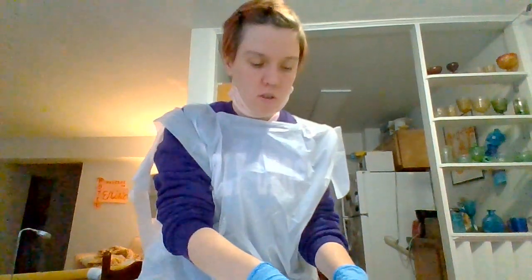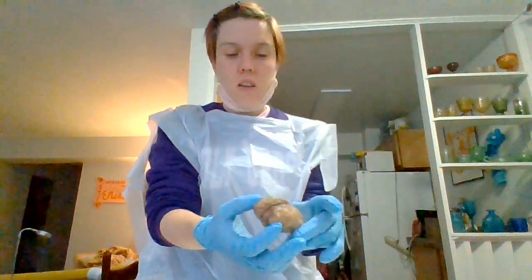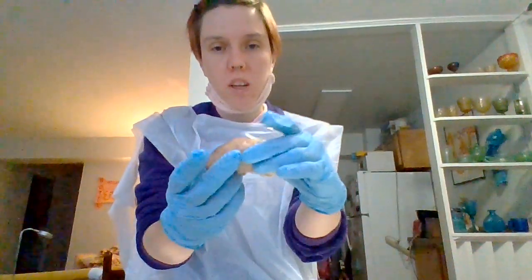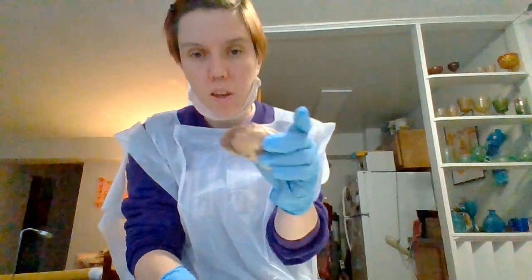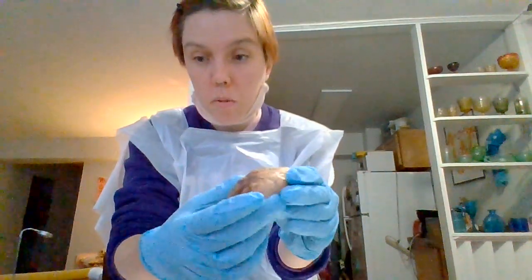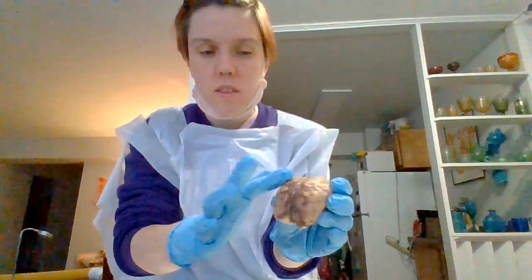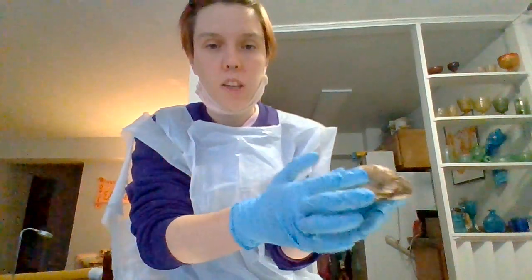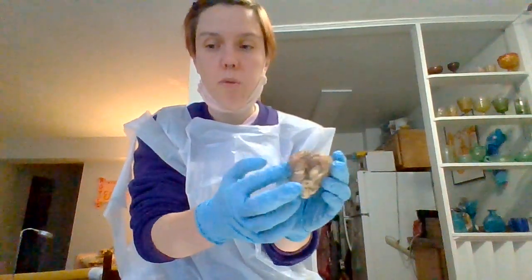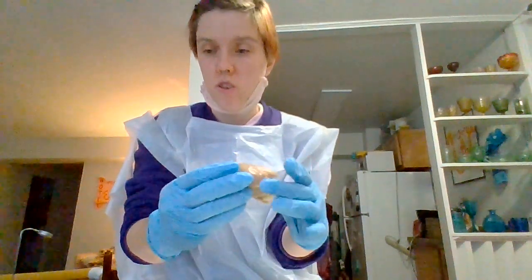So the next thing I'm going to show you, this is the upper half of the brain. I kind of ripped off the bottom half. The first thing I'm going to show you is the lobes. Here we've got the frontal lobe. The middle is the parietal lobe. If you go down to what would be under your ears, you have the temporal lobe, and then we have the occipital lobe in the back region.